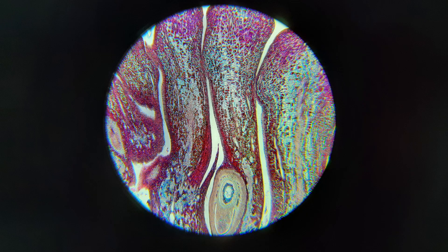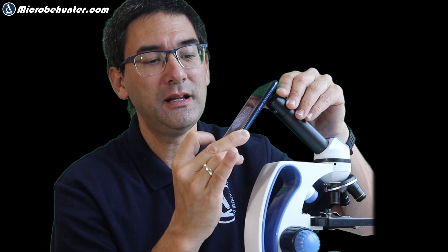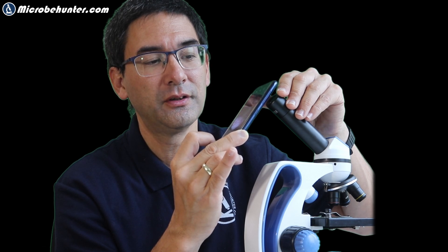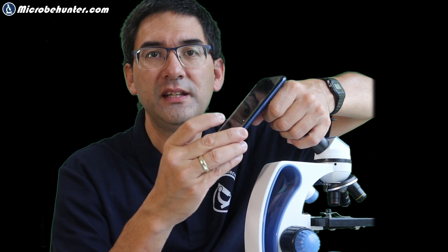Let me try it again. I'm adjusting the distance here, using my thumb — now everything is clear and I press the shutter. You can also zoom in first if you want, but I would say don't bother — it's only a digital zoom and you can always crop the picture later in a photo editing program. Zooming in, you don't gain anything, and you'll have more flexibility later anyway. So that's the tip: use two fingers or wrap it around, but you need some kind of rest, and then use your fingers to adjust the distance.